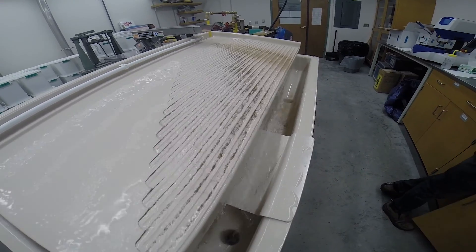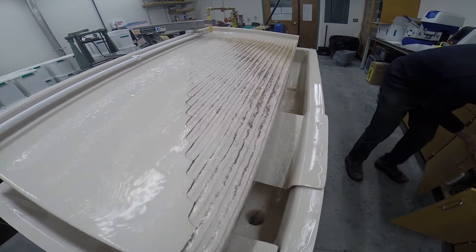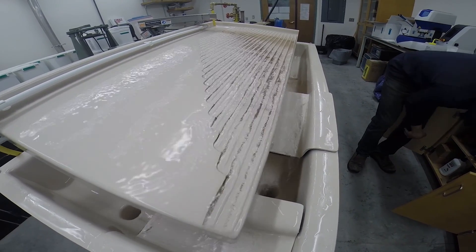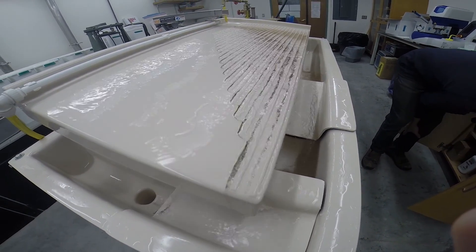As you can see, the lighter grains will float in the shaking table and be removed quickly. The dense grains like zircon will sink and travel all the way to the end of the table where we collect them.